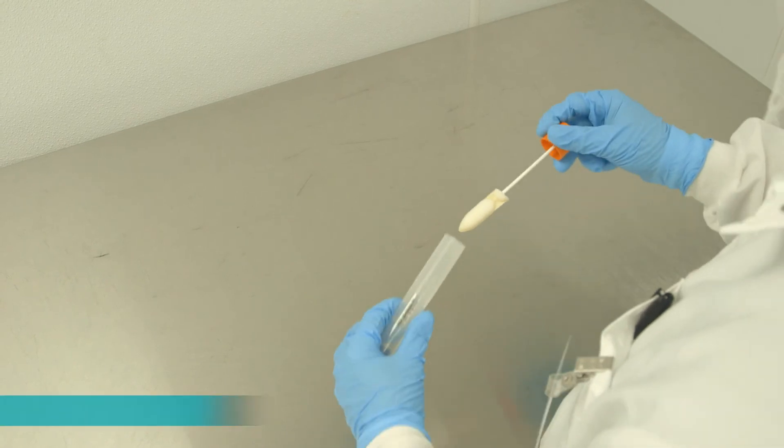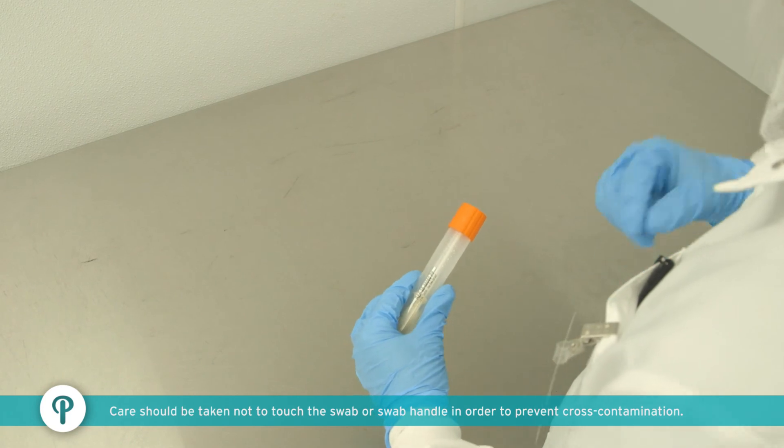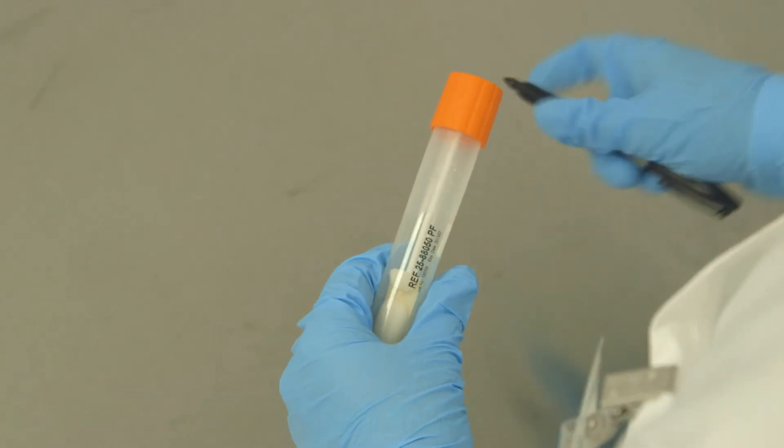Upon completion of sample collection, aseptically return swab into corresponding vial. Label vial with appropriate information.